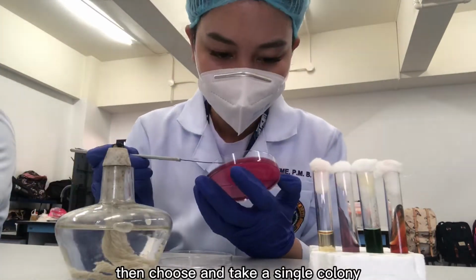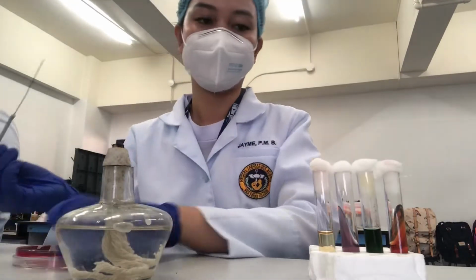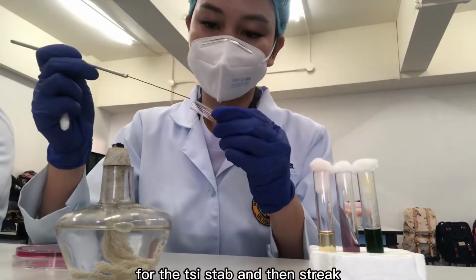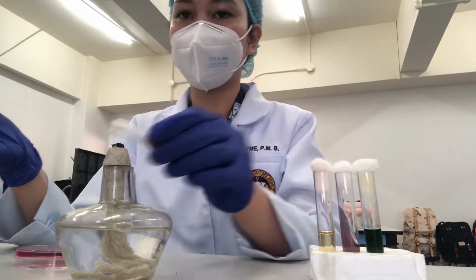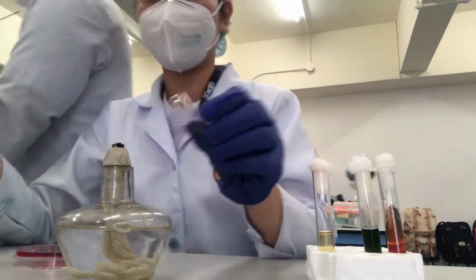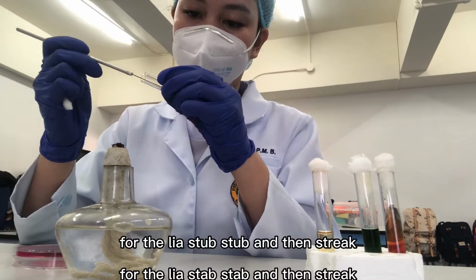Then choose and take a single colony. For the TSI, stab and then streak. For the LIA, stab and then streak.